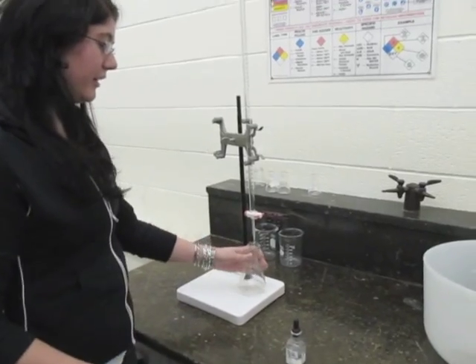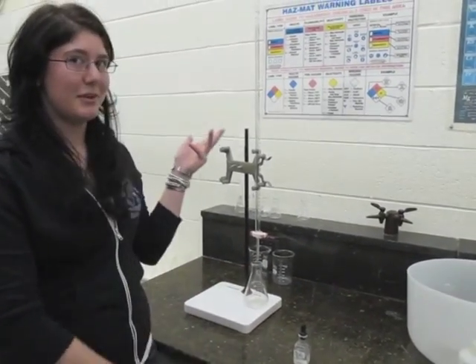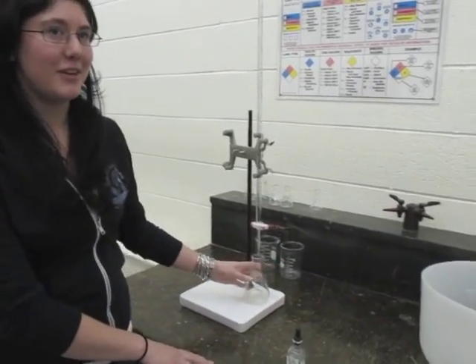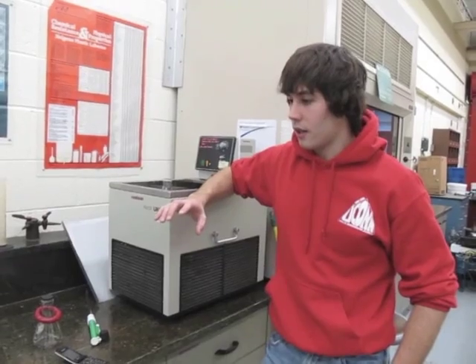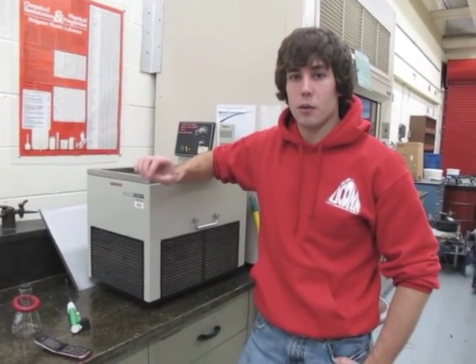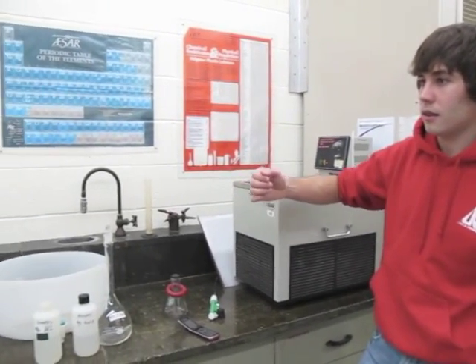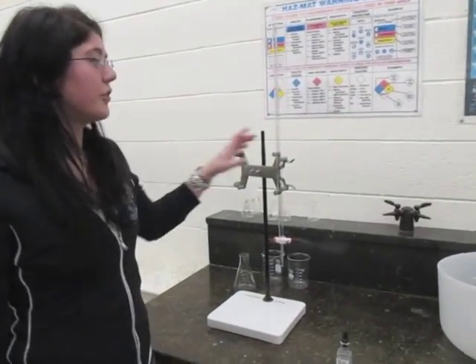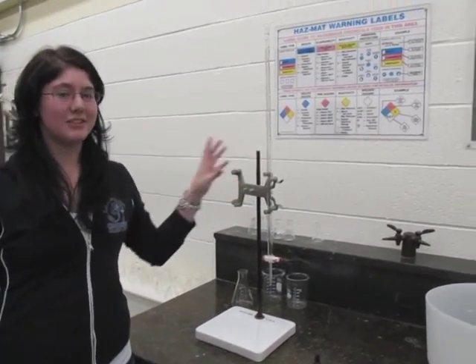You're going to add phenolphthalein indicator two drops and bring it to your burette that is filled with sodium hydroxide, and titrate until it turns pink, recording the initial and final volumes of sodium hydroxide in the burette. You're going to take samples every two minutes for the 20 and 30 degree trials, and every one minute for the 40 and 50 degree trials. You're going to keep taking samples until the amount of sodium hydroxide you add to each flask until it turns pink is the same.